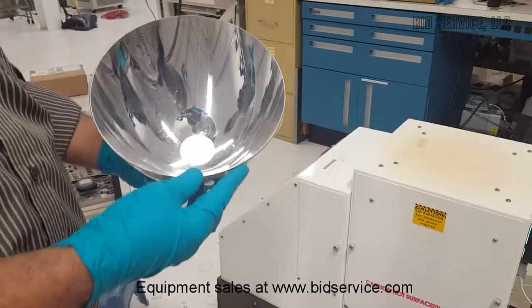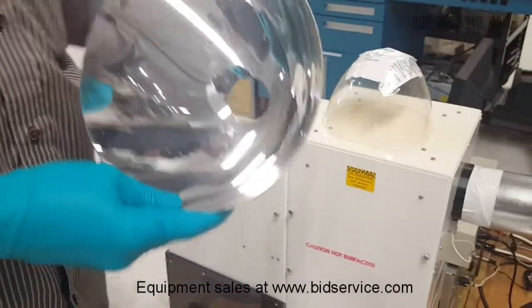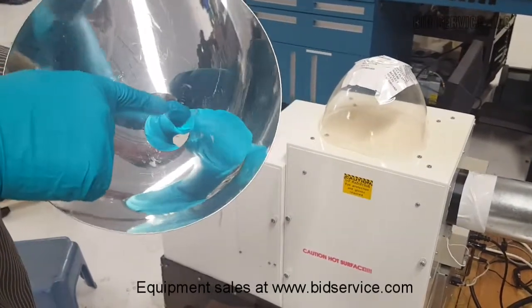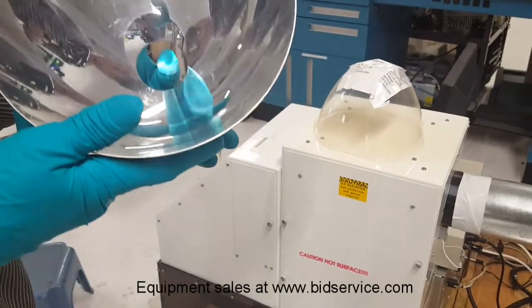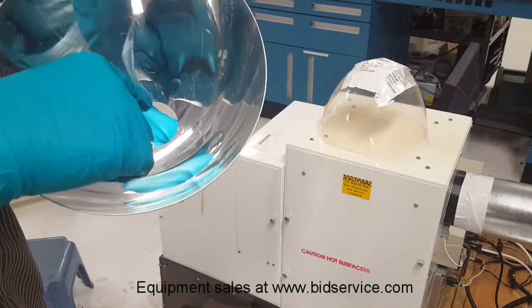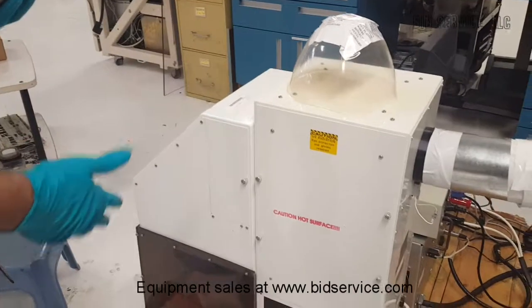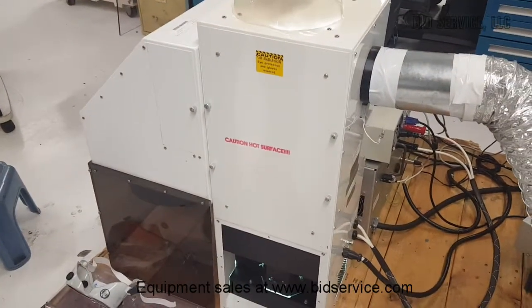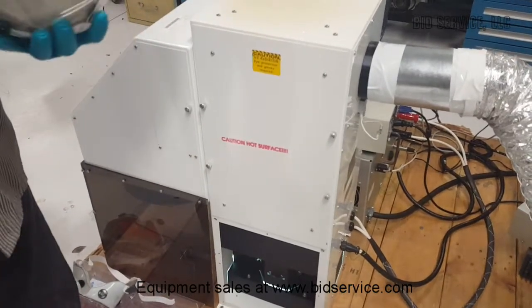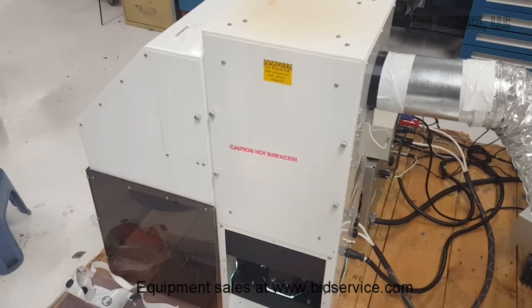This is the ellipsoidal reflector. The arc in the arc lamp should be at the focus, at the tip of my finger, around that location. By moving the lamp up and down, the positioning of the arc can be adjusted. By using an external meter and leaving the shutter open, we can see how the intensity level will peak when the lamp is exactly at the focus. Let me show that.